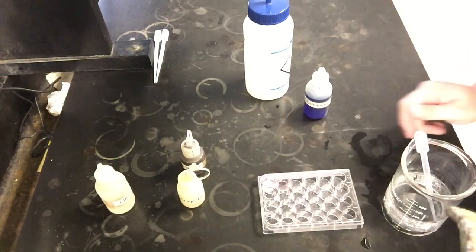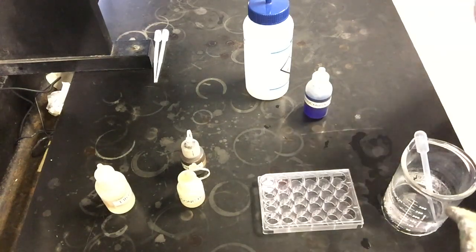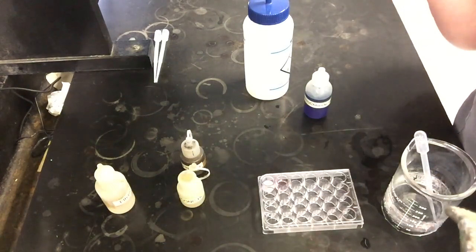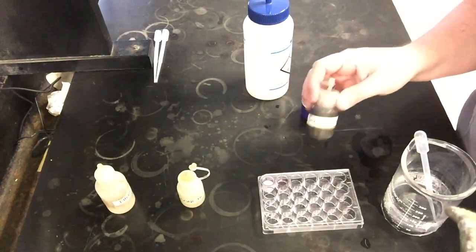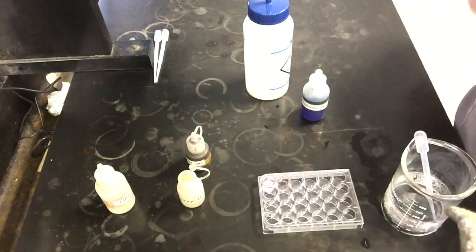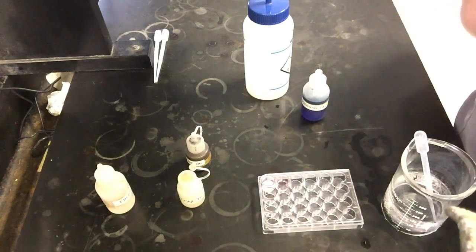So adding the silver nitrate, unlike HCl, actually favors the pink color, which is our product side. But it also made this white solid. And so that white solid, I think, is pretty key to the equilibrium in terms of understanding what's happening. So if you go back and look at the written equation for this equilibrium in particular, that's in your pre-lab and in your notes, if you look at that reaction, it should hopefully make sense that adding silver nitrate is doing something that creates both a white solid and causes us to favor the products of that reaction. So keep that in mind to help explain what's happening in that step.